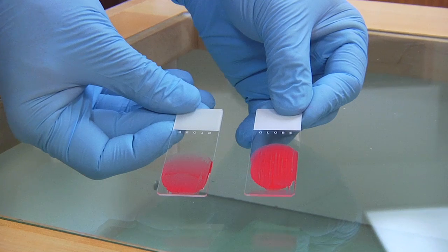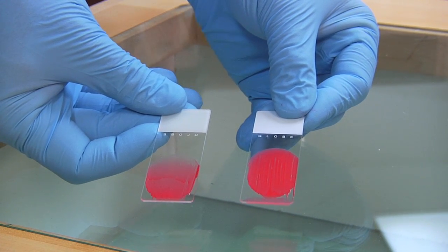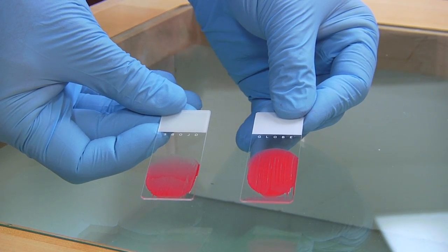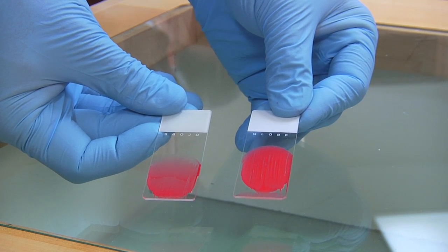This technique provides you material for alcohol fixative slide on the right and a Diff-Quik stain slide on the left. Material is evenly spread out as was in the first technique.